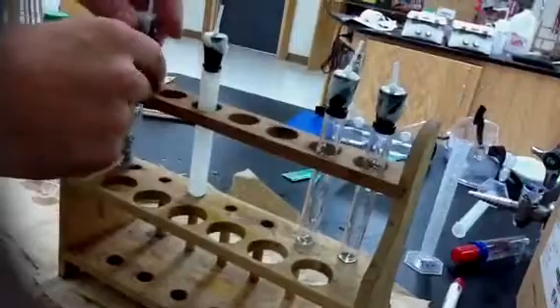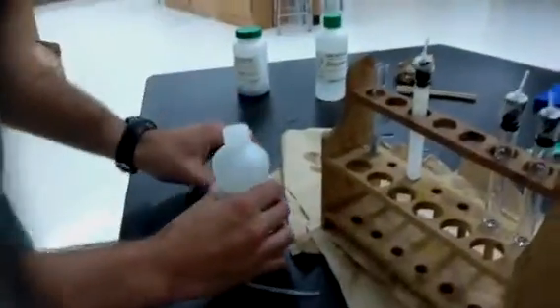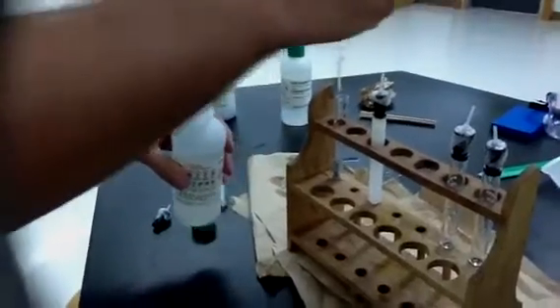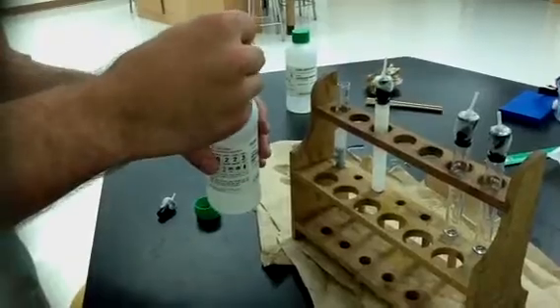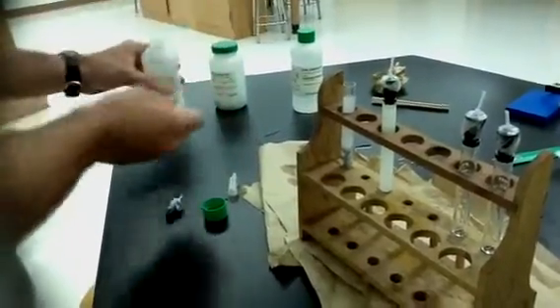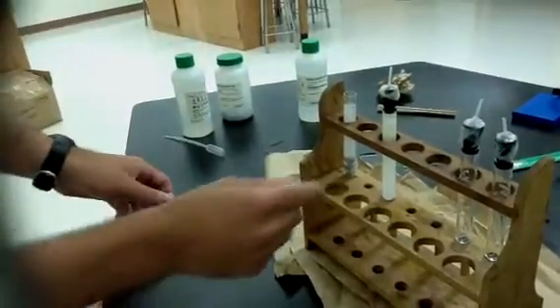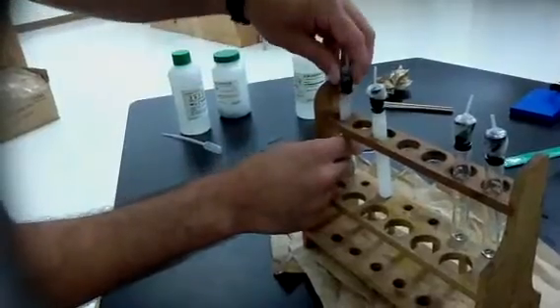Next, I have to start up my hydrogen gas generator. I'm going to open up my hydrochloric acid solution. I'm going to put in my hydrochloric acid. I should be wearing gloves right now because this is a very dangerous chemical, but note that I am wearing goggles. And I'm doing a very careful job to make sure I'm not going to get any of this on my body because that would be very dangerous. So I've got hydrogen. As you can see, if I touch this, it is hot. This test tube is getting very, very warm, which is an interesting result.